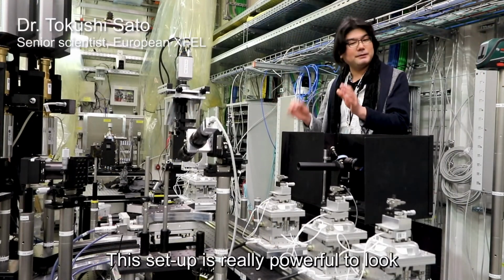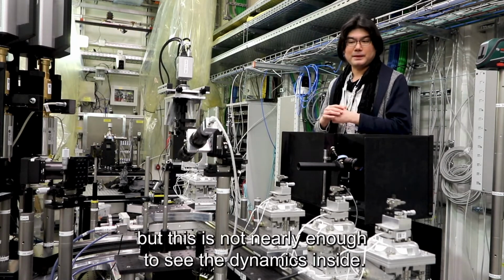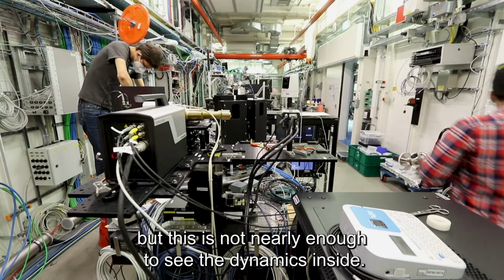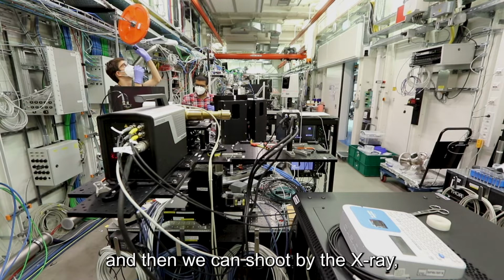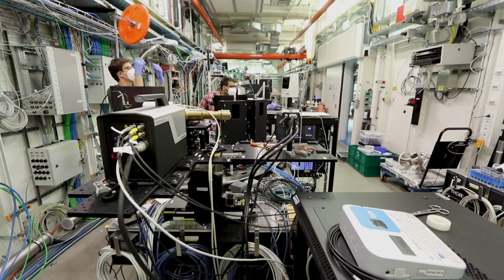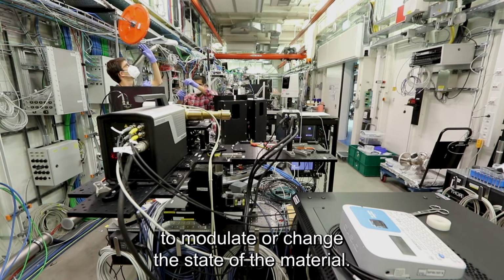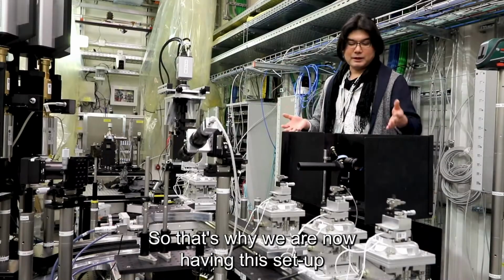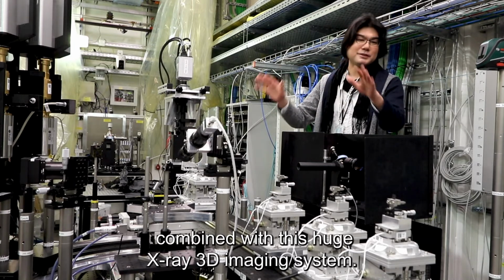So this setup is really powerful to look at the detail of the microstructure of the material, but this is really not enough to see the dynamics inside. We have to excite the material and change its state, and then we can shoot with the X-ray. Then we can take the movie in 3D. To do this, we have to have this pump and probe laser to modulate or change the state of the material. That's why we are now having this setup combined with this huge X-ray 3D imaging system.